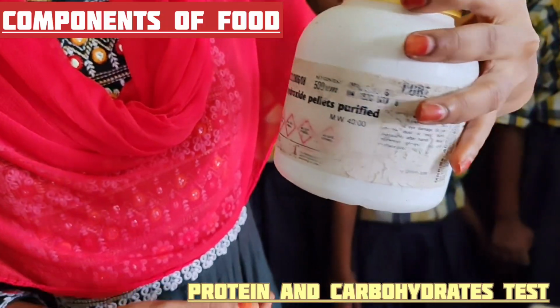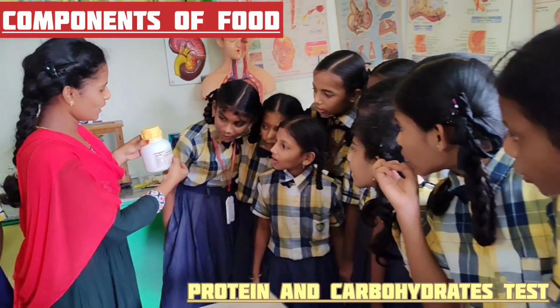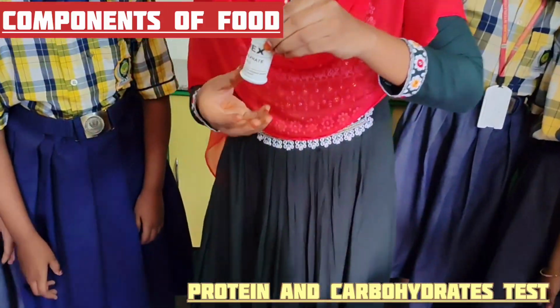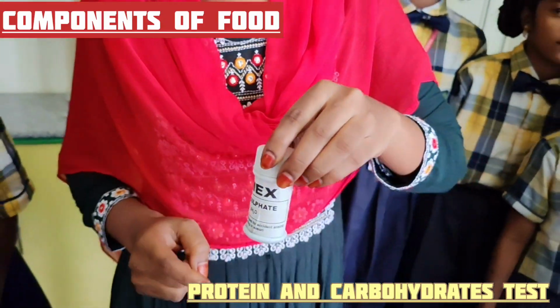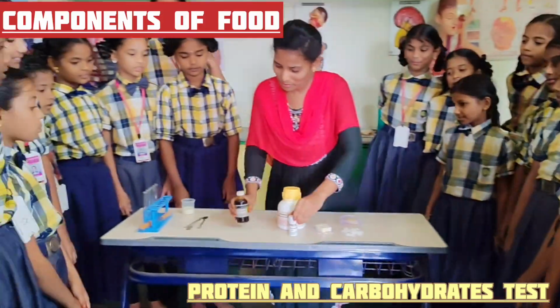What is this one? Sodium hydroxide pellets. Once observe? Sodium hydroxide. Okay. And now this one? Copper sulfate. Copper sulfate. What is this one?